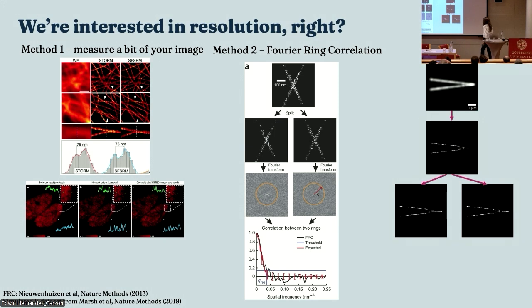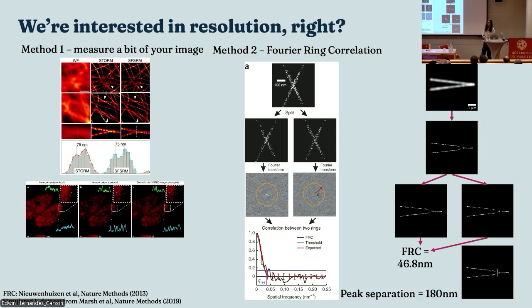And there's a problem here. And that problem is that it's wrong on the same spatial scale in both images, okay? It's this bit here, which is wrong. It correlates very well with that wrongness. So your resolution will come out as, oh, great, 46 nanometers resolution. Whereas if we went to the dumb method one, we'd say, well, actually, about here is the closest place we can measure that separation, and that's 180 nanometers. So there is no good way to measure resolution in single molecule localization data, I'm afraid.